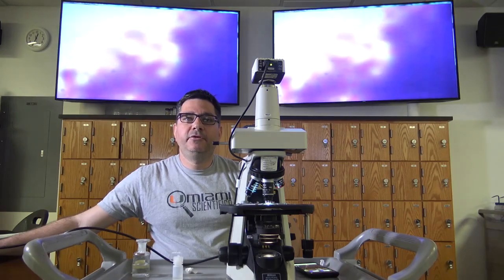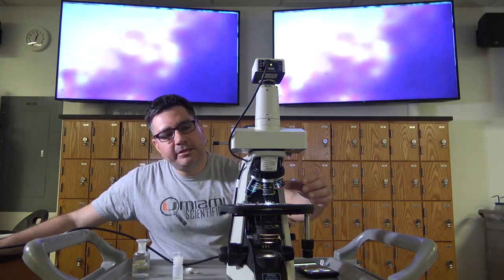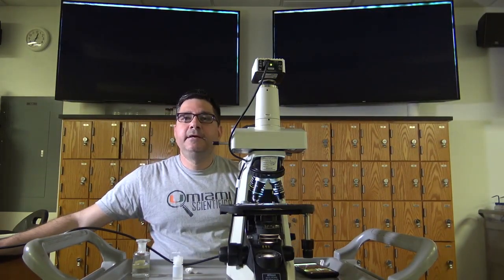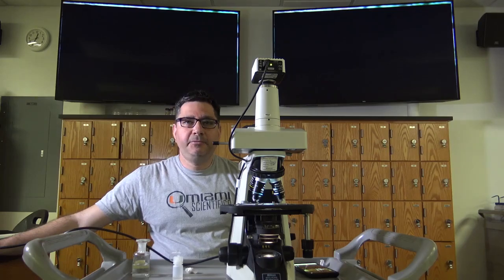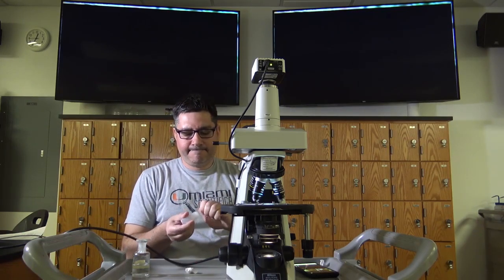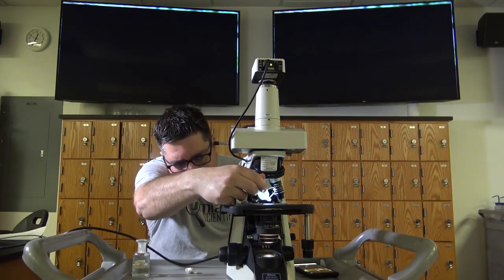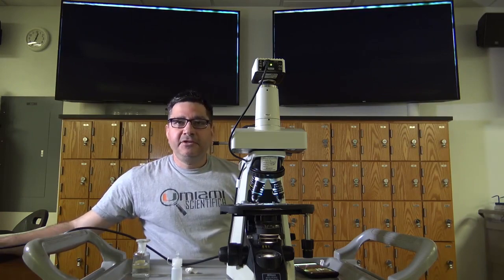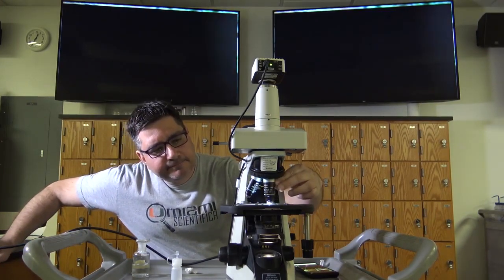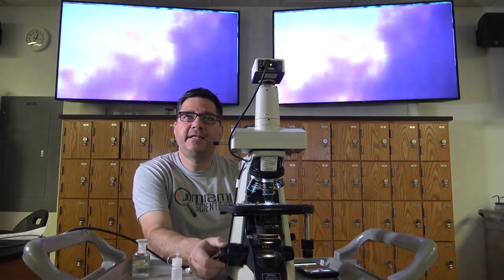Dial the turret so that you are neither at the 40 or the 100x objective, but rather in between the two. Next, place a drop of oil, not too big and not too small, on the slide. Using the turret, dial your objective back to the 100x objective. Find focus and adjust the diaphragm and condenser.